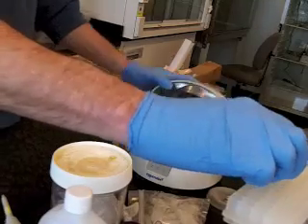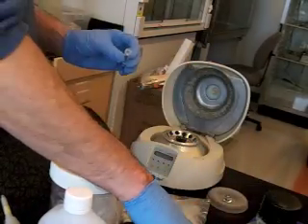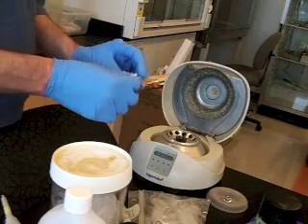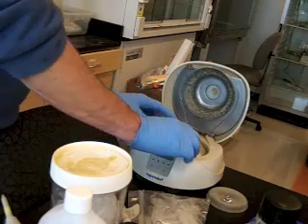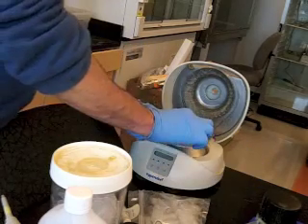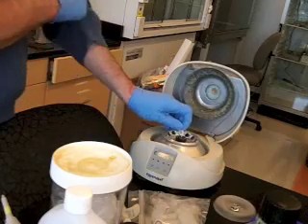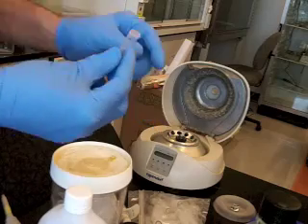And then the final thing I just want to point out on here is that often with these little tubes, we'll give them a spin, and the convention is that we'll put the hinges pointing out. And so we'll spin in a centrifuge. We need to have the tubes balanced across from each other, and we'll put the hinges out, and then this little cap snaps on like that, and snaps on for this centrifuge. And the reason we put the hinge out is because this is called a fixed angle rotor.